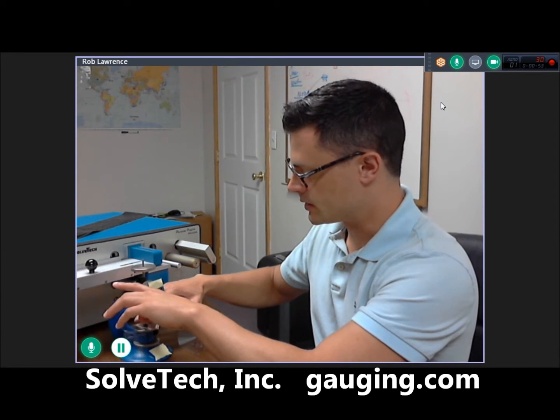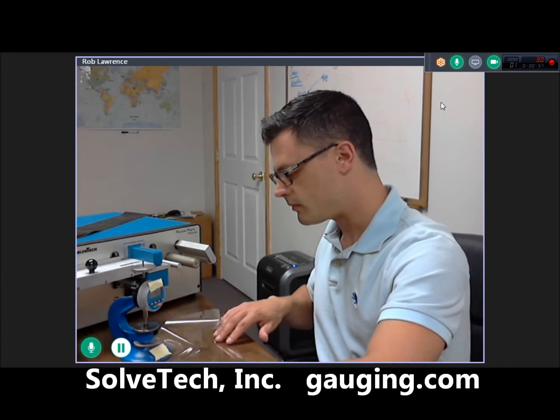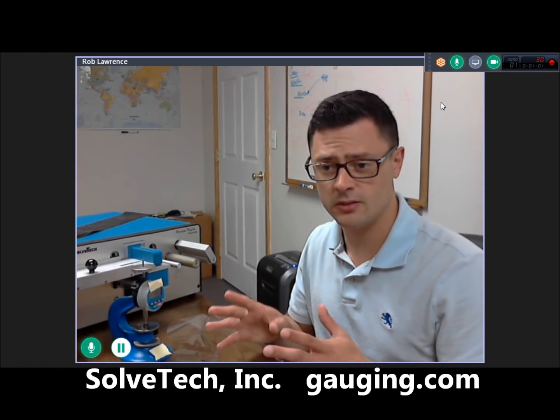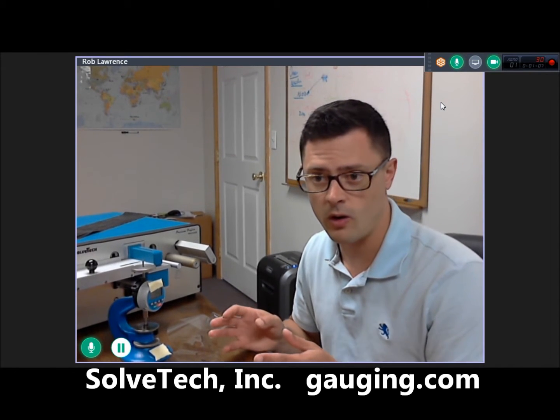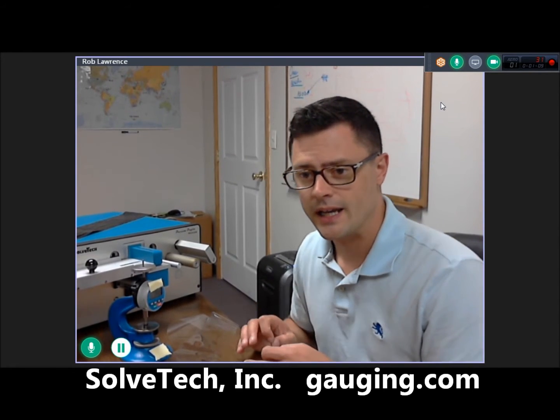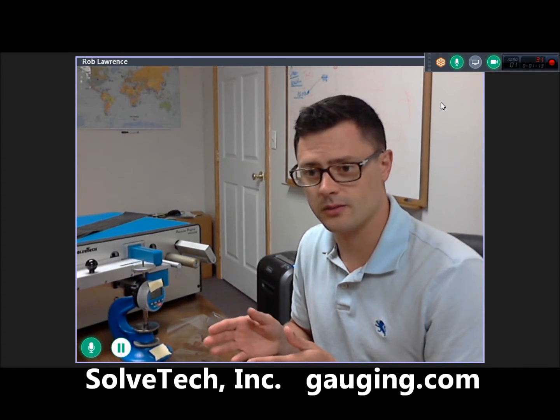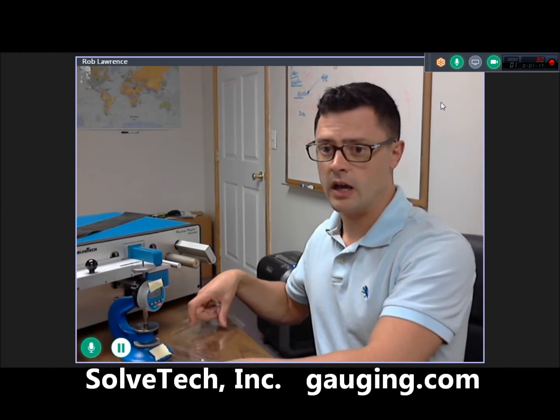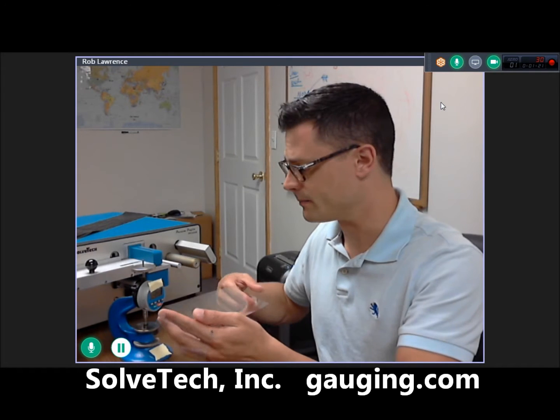Now the precision on this device is about 1 micron. So it's good for estimating approximately where you are on thickness on average, but if you're trying to look at material variability, which a lot of people are for quality control purposes, then you really need something with higher precision, because the precision on this device is about 4% of my overall material thickness, and this material I know is about plus or minus 2% on its variability.